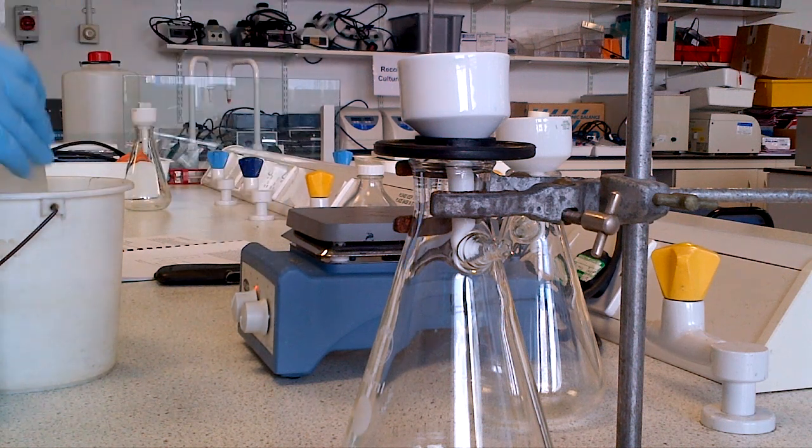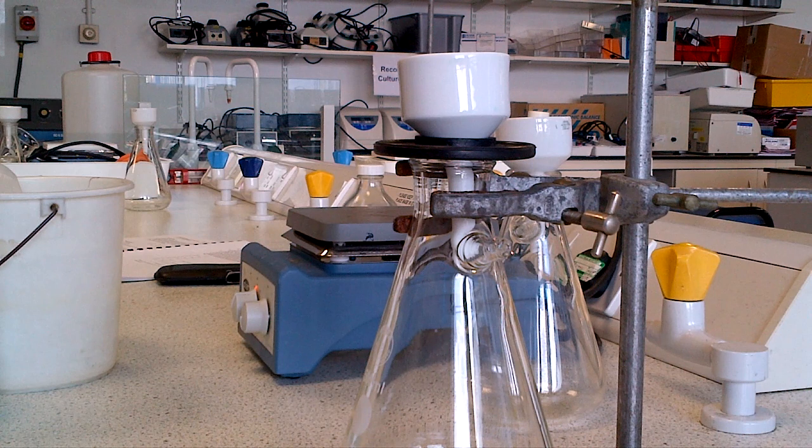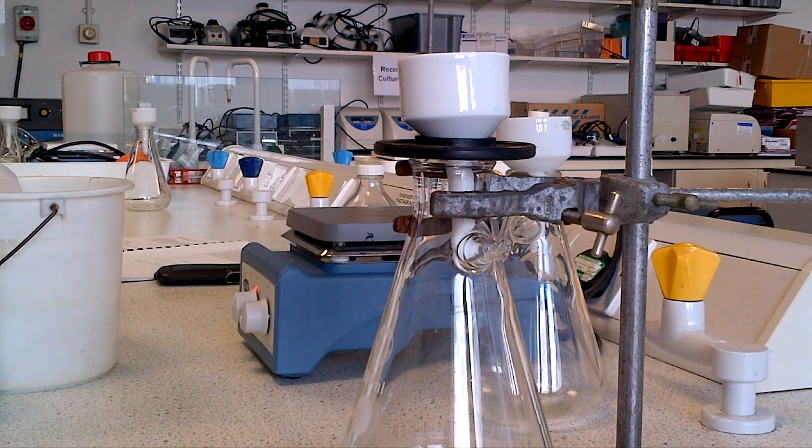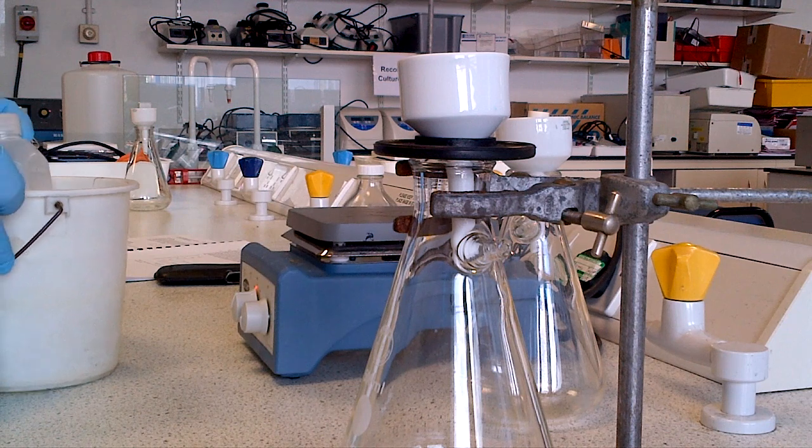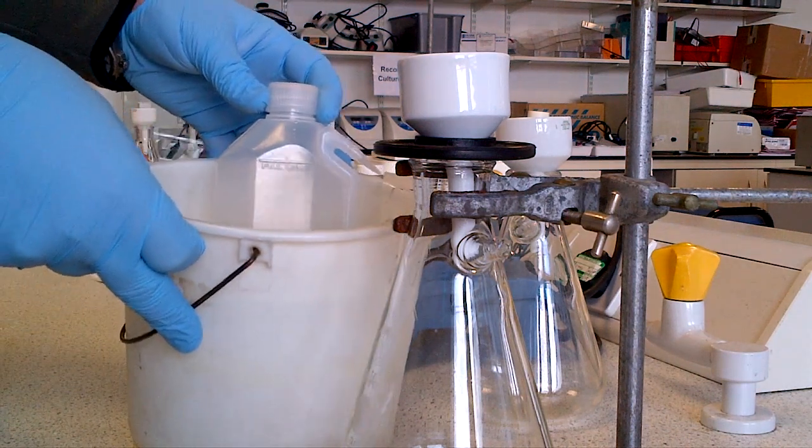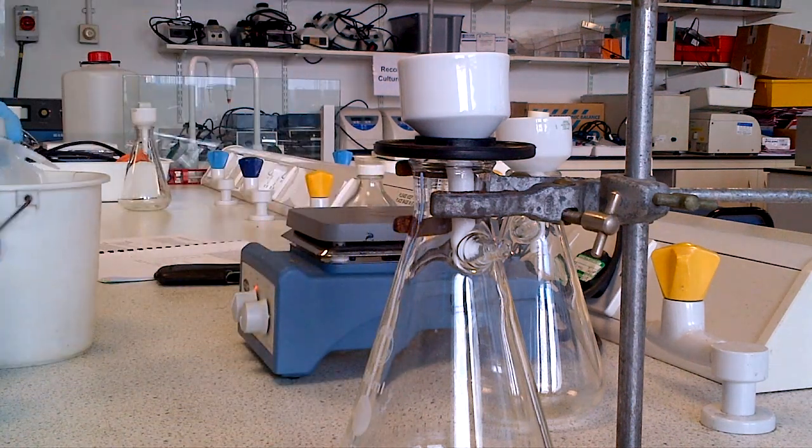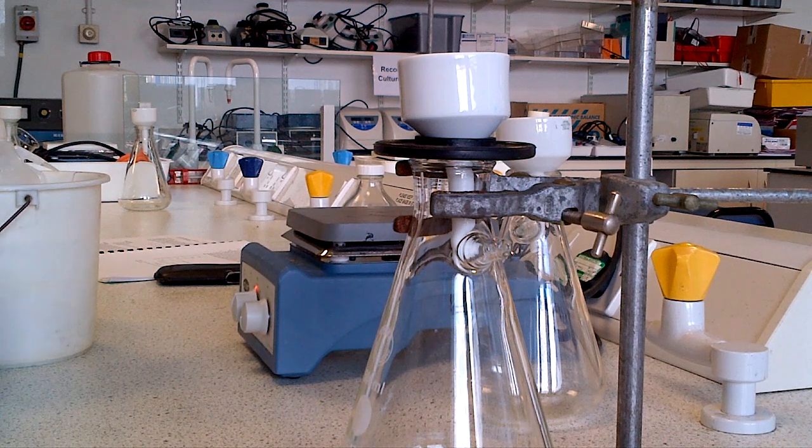The procedure says you should wash the salicylic acid crystals out of the beaker with cold solvent, which is cold ice water. Take your water bottle and place it into your ice bucket as appropriate before you start to filter.